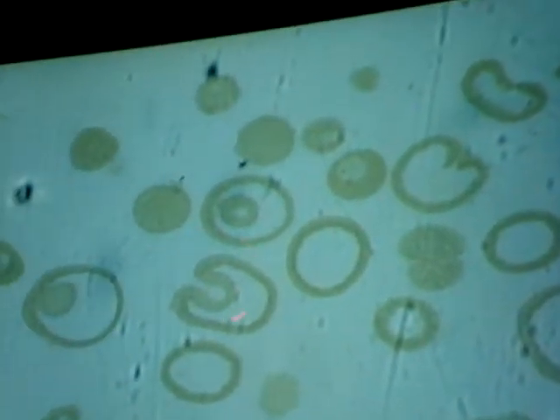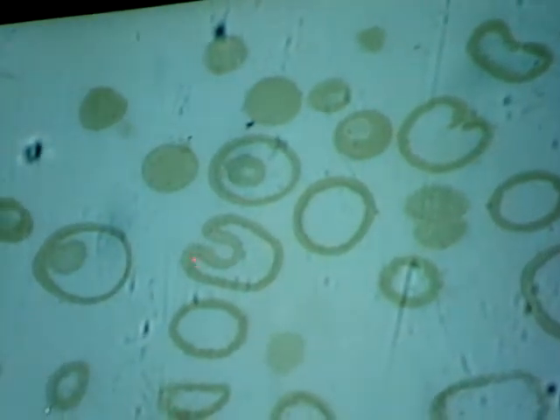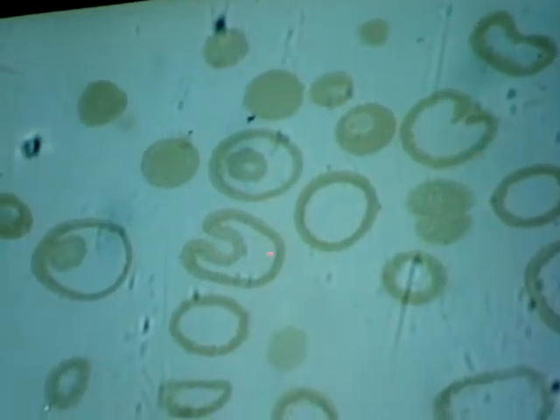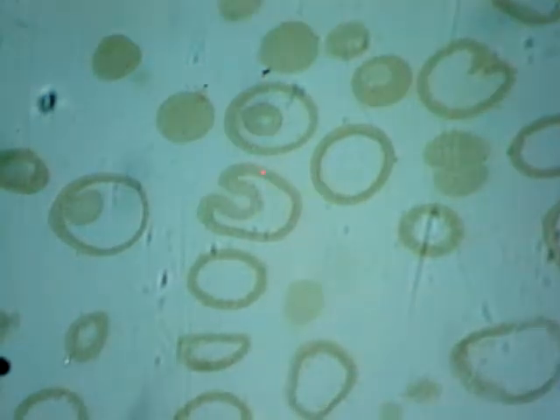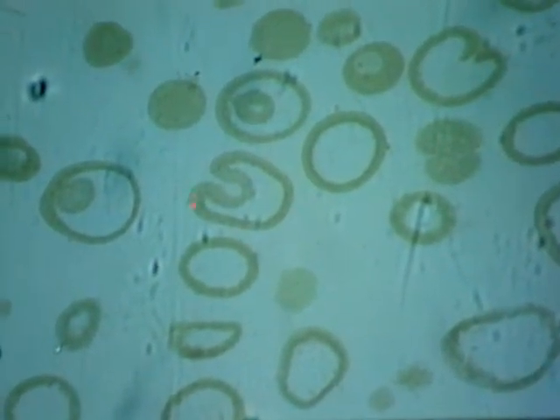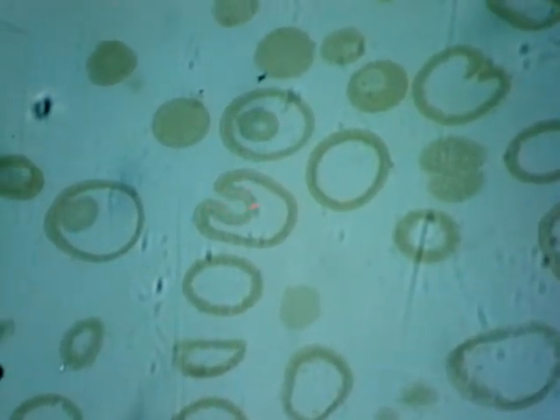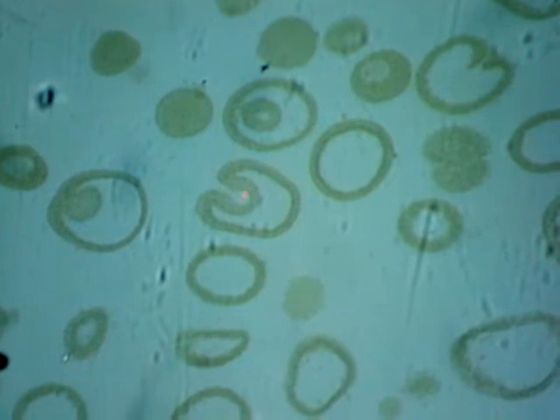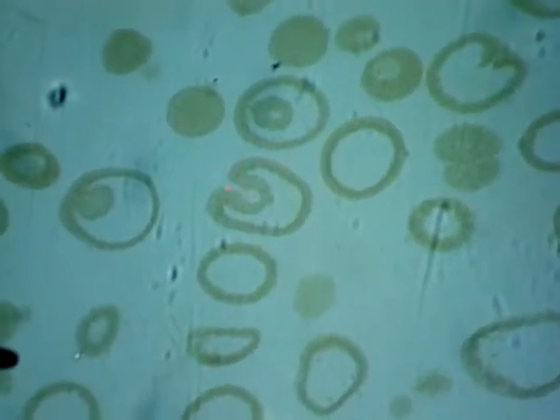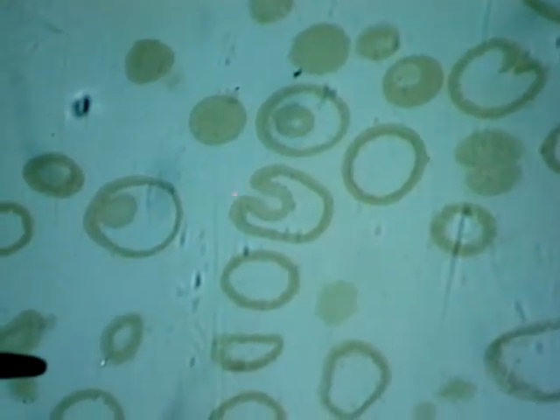We're going to look at this one right here. So this is a blastula or blastocyst, and then it's going to start to make this indentation right here. This is still the blastocoel, the space. But then we have the ectoderm. Ecto means outside, so this layer on the outside is now the ectoderm. The layer right here is going to be the endoderm. The canal that's right here, that's the archenteron. And then the opening that's right here is the blastopore. And that's what's going to become the human's anus.